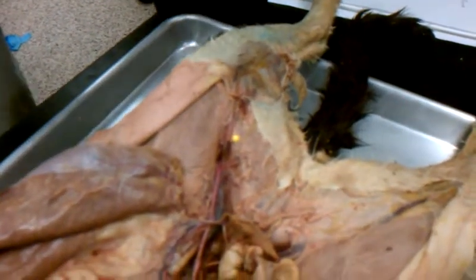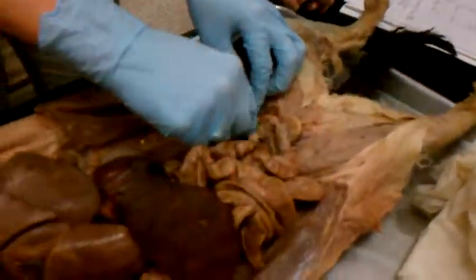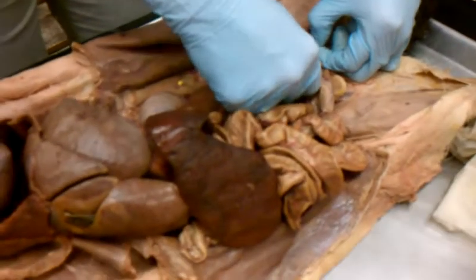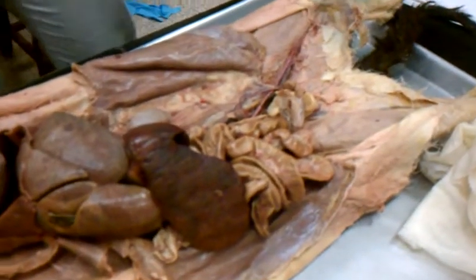So where does the external and the internal separate? So on this one, that's what I'm saying. I'm having trouble finding it on this one. I will look at another cat and try to show you. In terms of pulling this up, it looks like it's down here, but it's not separated yet. And so you'll see it go straight into the leg. So those are your arteries. Any questions over the arteries?